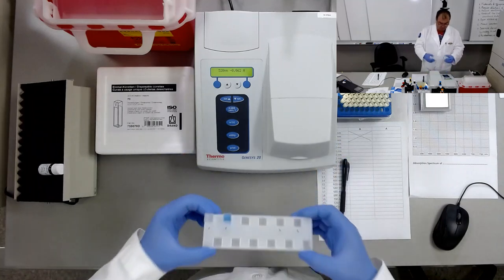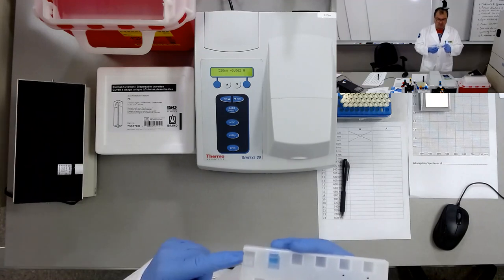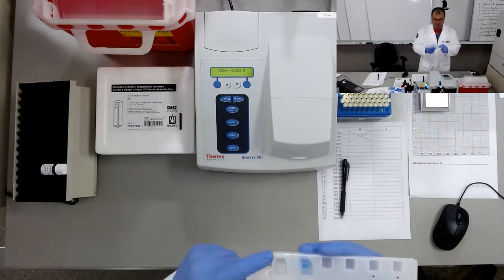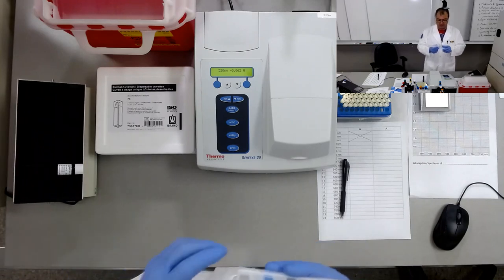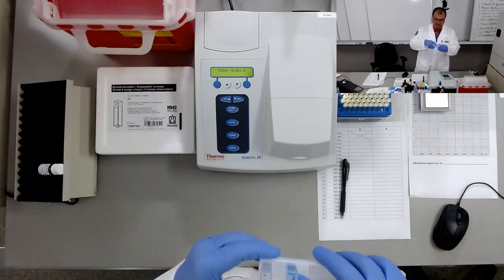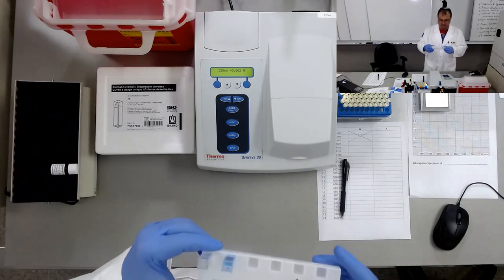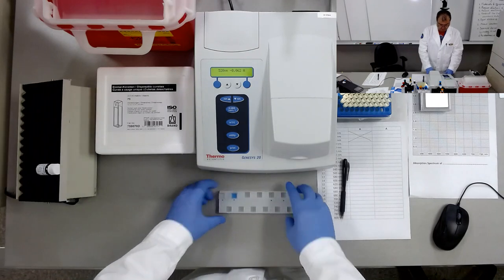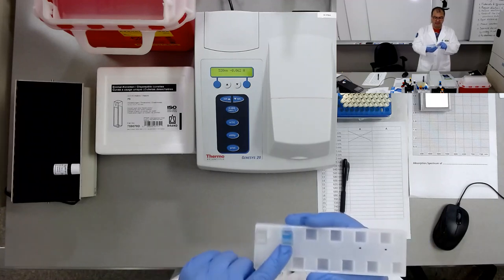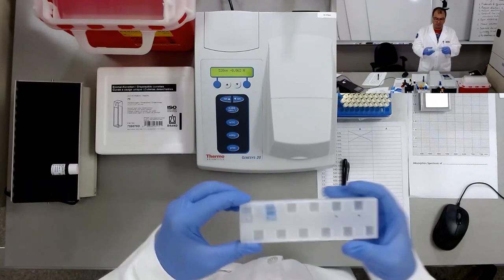We have the cuvettes, which I already prepared. The first cuvette is the blank used as a reference. This one contains distilled water, about 2 milliliters, and the second cuvette has the particular sample, the analyte that we would like to get the absorption spectrum for. This one is a total protein reagent. So today we are going to plot the absorption spectrum for this total protein reagent.